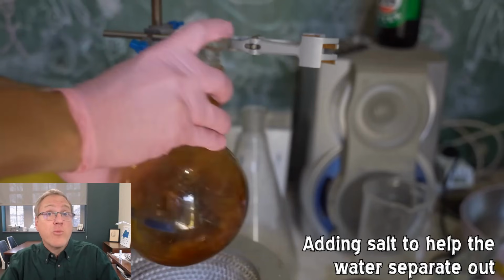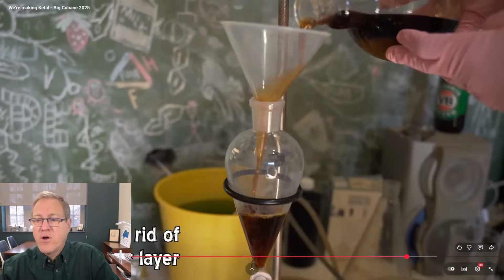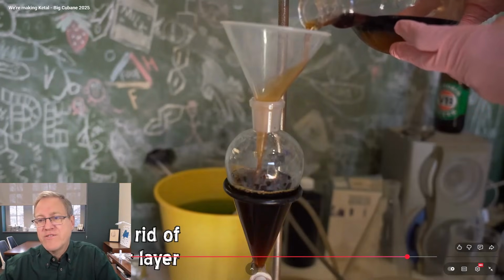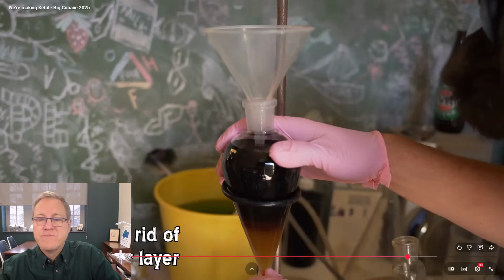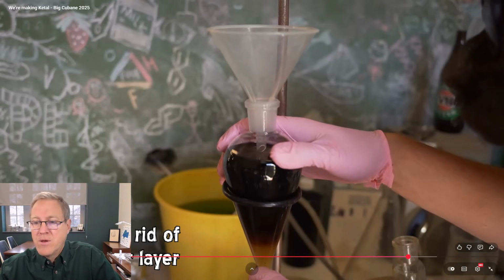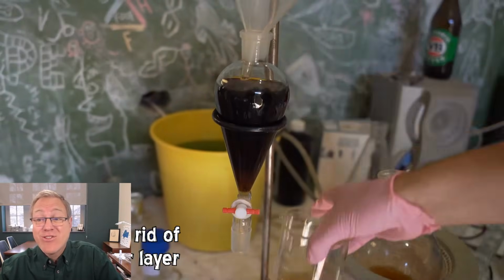It'll float on top. That will be where his organic product is. Mixing it all up, putting it in a sep funnel that allows them to separate out the layers. You can see that bottom layer is a little bit clearer, a little bit lighter color. That's the aqueous layer, and he's going to drain that off to get rid of the water layer. And that should get rid of any excess ethylene glycol.